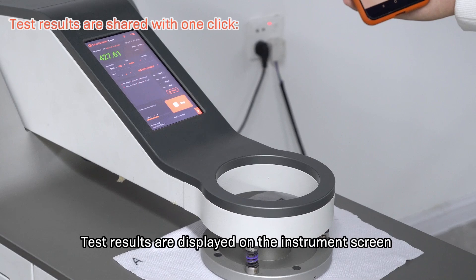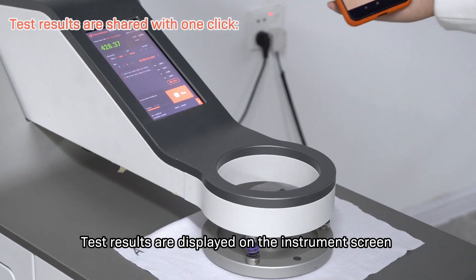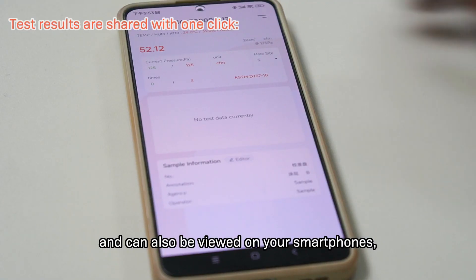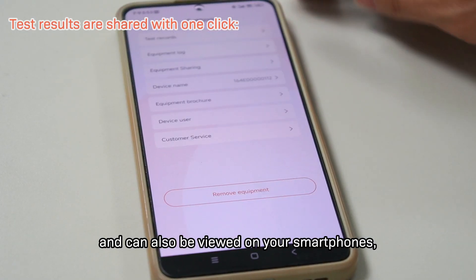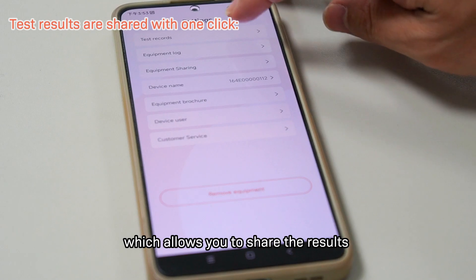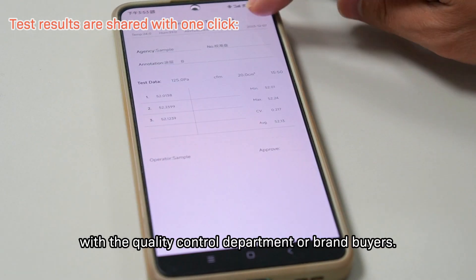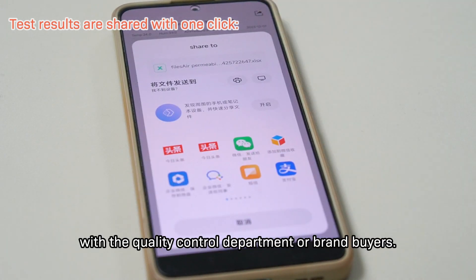Test results are displayed on the instrument screen and can also be viewed on your smartphone, which allows you to share the results with the quality control department or brand buyers.